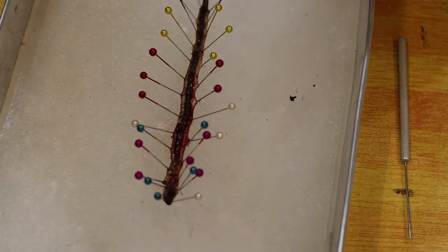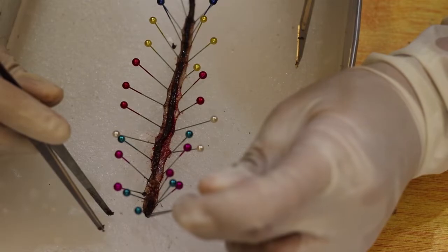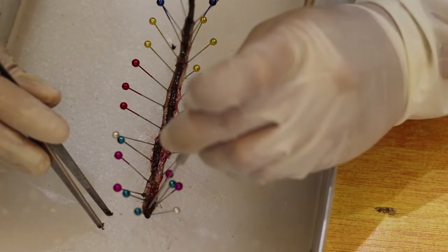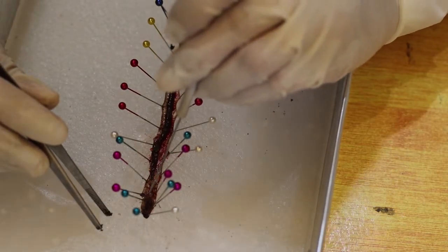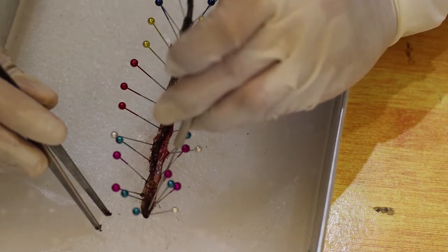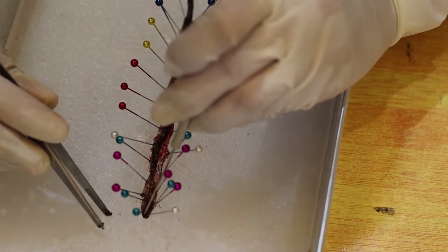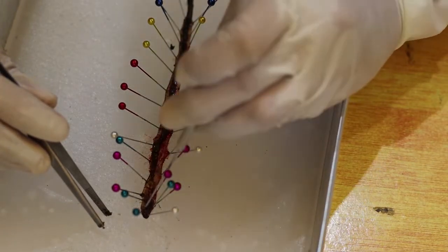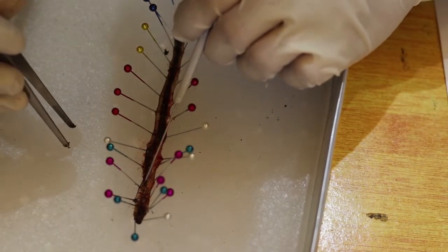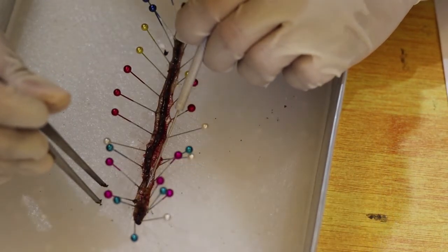Now, let's locate the different internal parts. So right here, in the front is the mouth, which is the opening. And this is the brain, or what you call the dorsal ganglia, right here, which surrounds the anterior end of the pharynx. This paired dorsal ganglia acts as the brain of the earthworm. Then down to the pharynx here, then down to the esophagus. So there are two small yellowish parts right here. This is what you call nephridia.